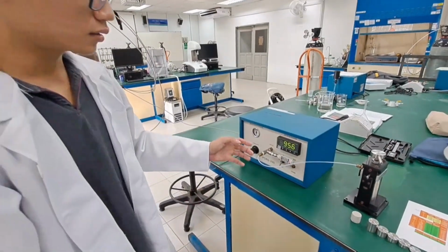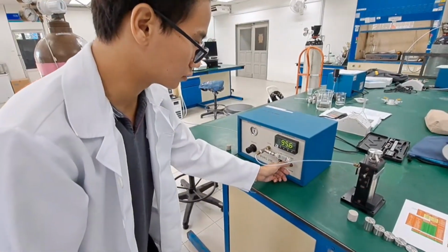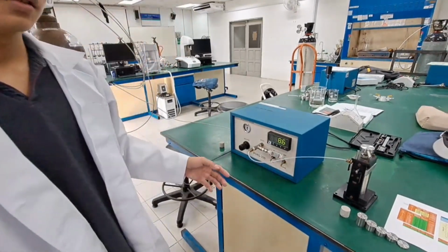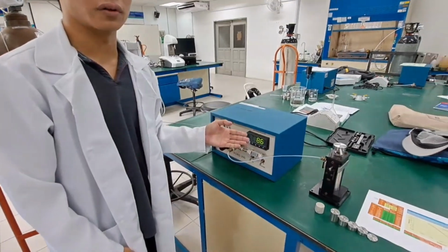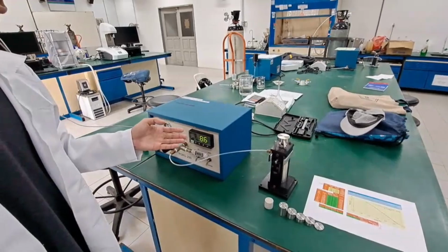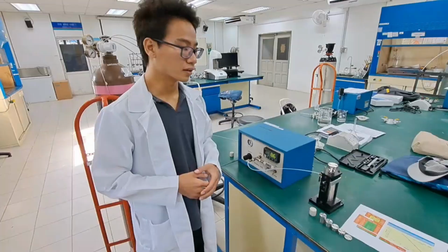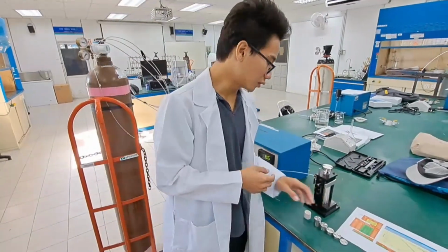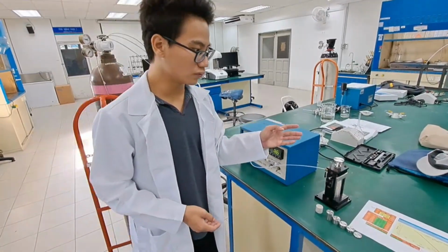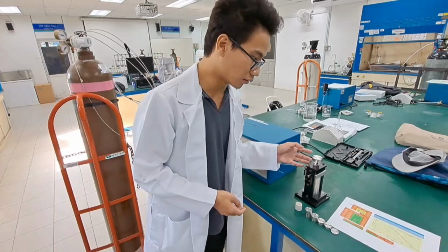We wait for a while. Later on, we go to the experiment. Here, this is our second reading for our pressure volumes. After this, we get the second reading for our first one. Then we need to do the same for the second sample, the first test.